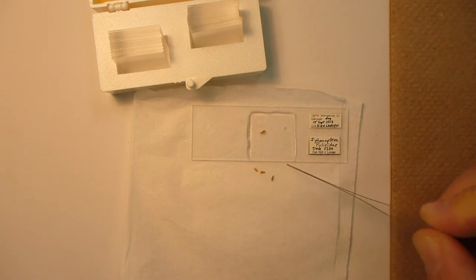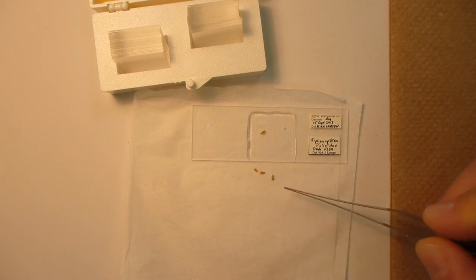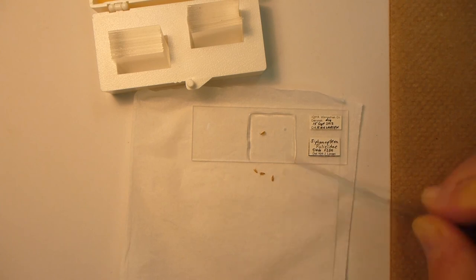These extra specimens here I can make additional slides with. They were all collected in alcohol and had been sitting preserved in alcohol. I dried them on paper towel and then placed them on a kim wipe so that I could easily see them while making this video. Thank you very much.